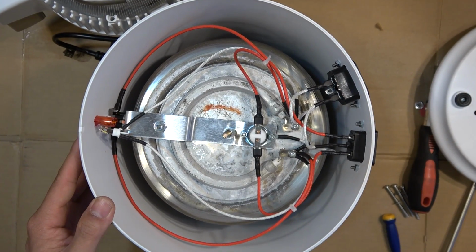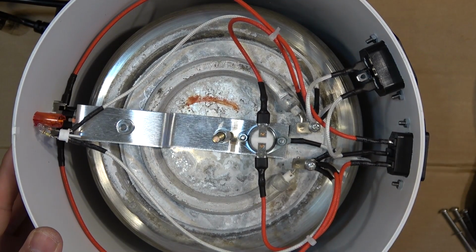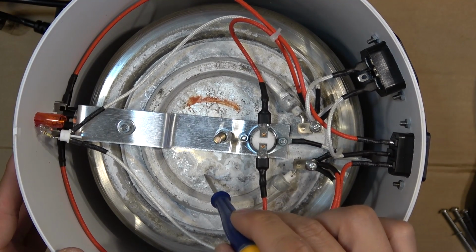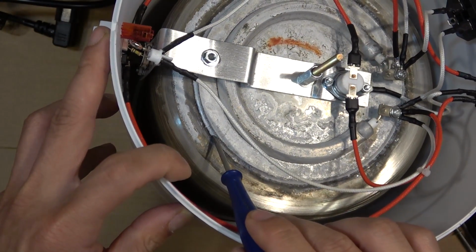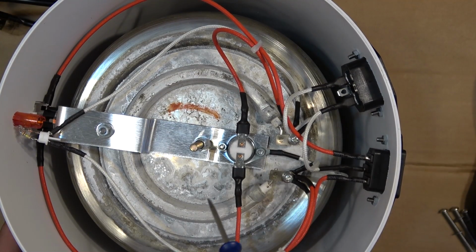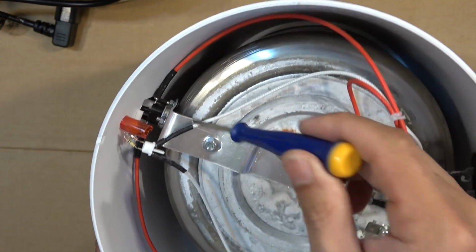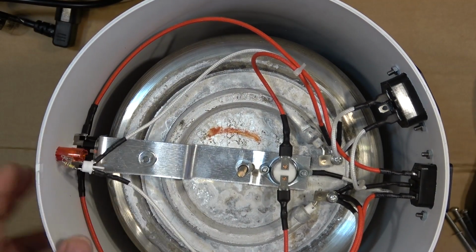Let me zoom in, take a closer look here. So we got a heating element right here and it's mounted on a metal plate, and this plate is welded onto the bottom of the pot. We got two heat sensors, one here, one over here, which is also the power switch. You got a light bulb, and that's it.